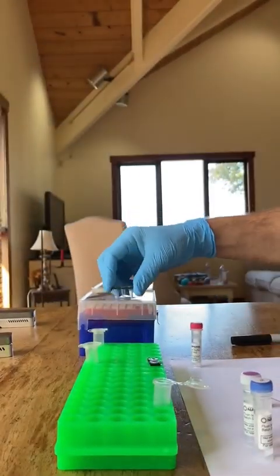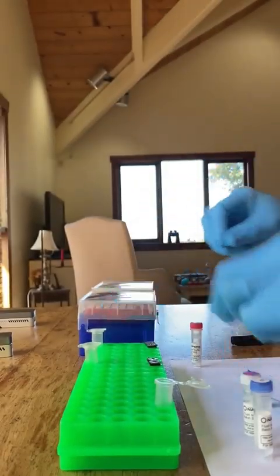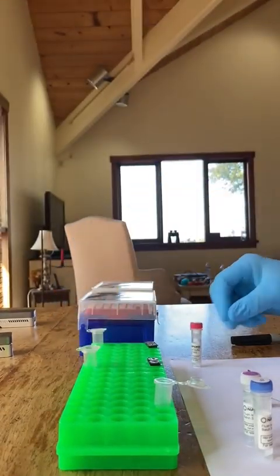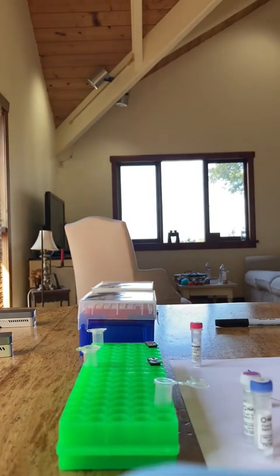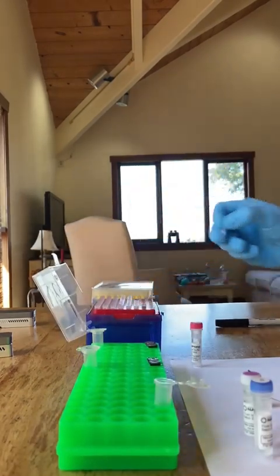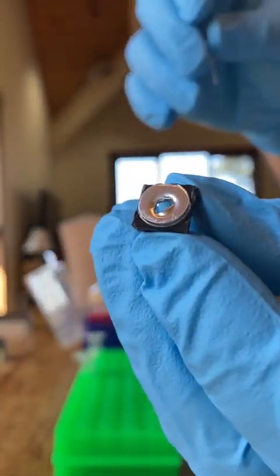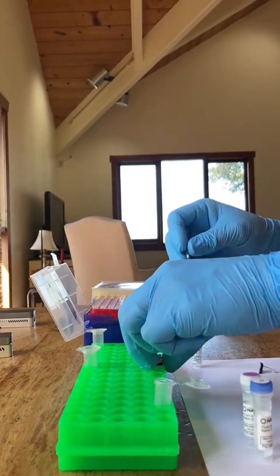And there's the second packet, ditching the silica gel. This also has 3 tubes on it. You bend it and break off tube number 1, and I place those in front of me. Now what I'm showing you are 2 tubes that are full of DNA, L tube and S tube, which contain the DNA from the bacteria that I isolated on the edge of the spinach leaf. With tube 1, what I like to do is make a little pilot hole there with a sterile pipette tip. In both of these, I'm making just a little hole, opening it up, because what I'm going to do next is transfer the DNA into that tube.